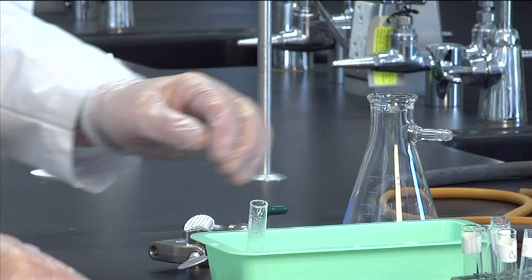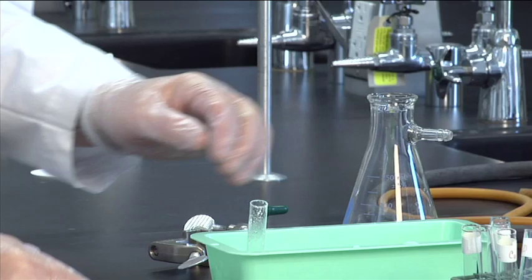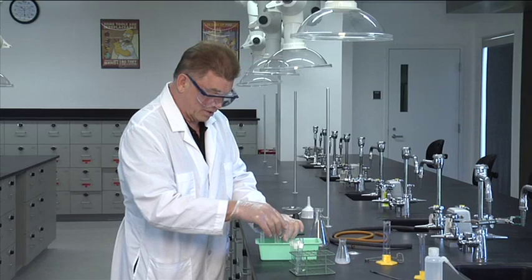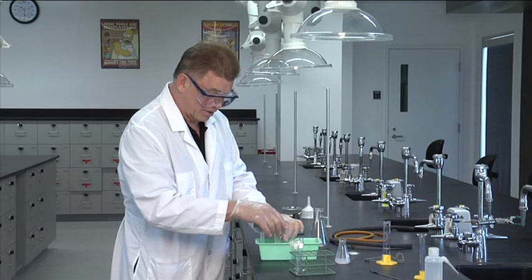So I'm going to just stick this tube in. That was the water. You know, just for fun, let's put - see, it's liquid cyclohexane, liquid. Now we're going to put cyclohexane in there. We'll come back and revisit that guy in a few minutes.